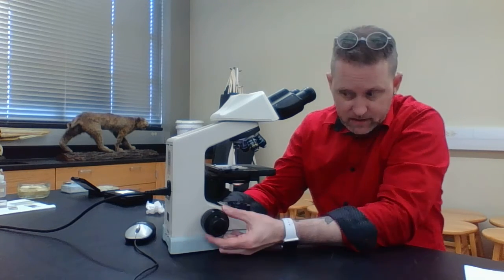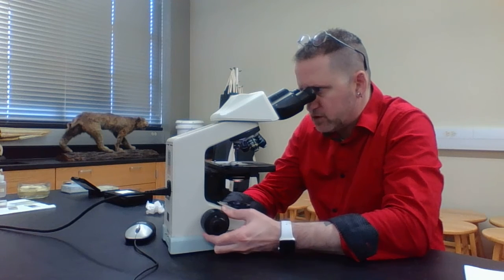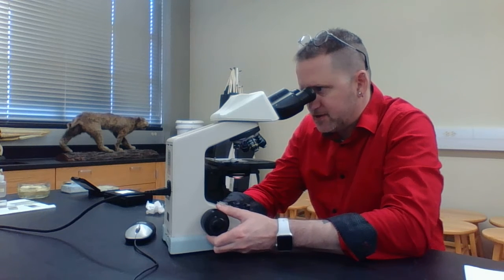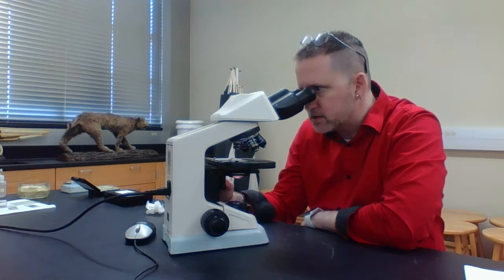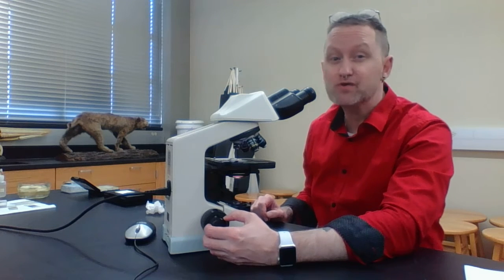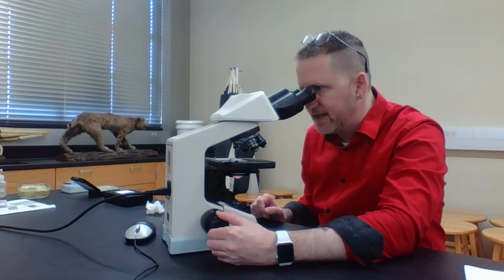And what I'm going to do again is use my coarse focus knob, and I'm going to twist it until everything gets into focus. Make sure that when you do this, you can adjust it using either the back-and-forth or right-to-left adjustment knobs. You may have to adjust it using your fine focus, but you want to make sure that each thread, regardless of whether it's blue, red, or yellow, is in focus.